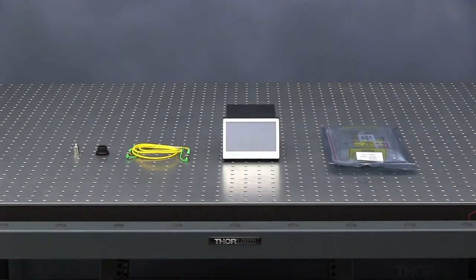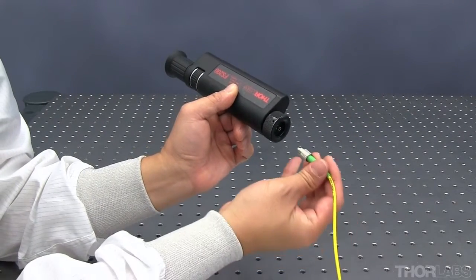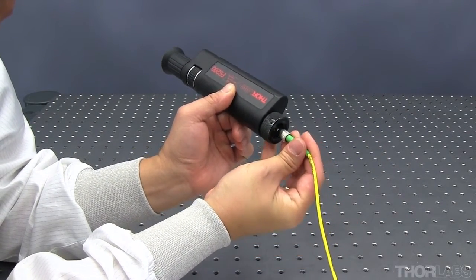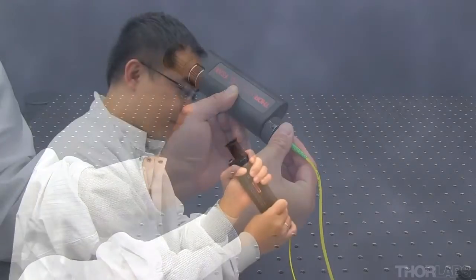Installing the laser system. Using the recommended fiber scope, inspect all of the system's fiber connectors. Clean each fiber tip before using it in the OTKB system.